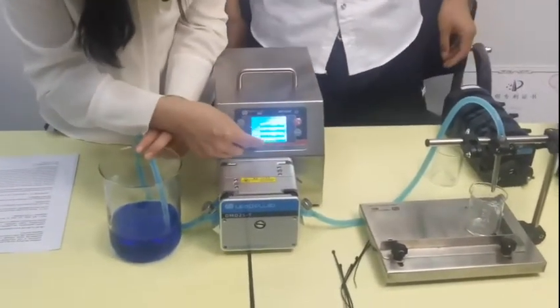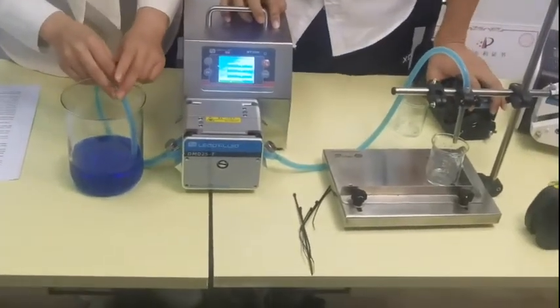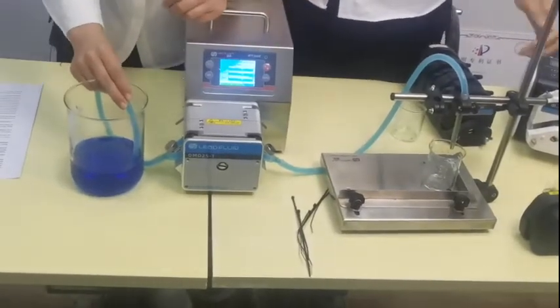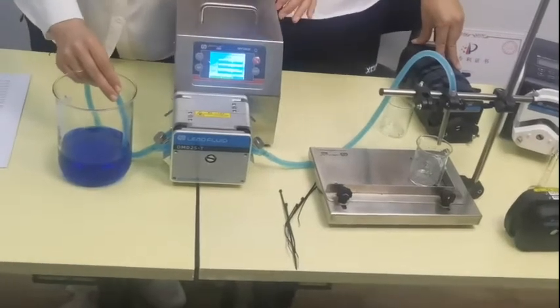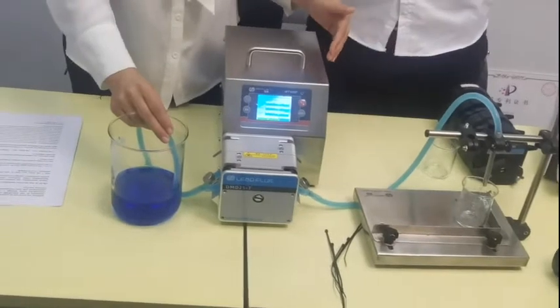Okay, let's press next, and then go down. There are three tests we need to do. After testing three times, we can put in the true volume you get, putting it into the pump. The pump will memorize the tolerance, then you can get the exact volume.